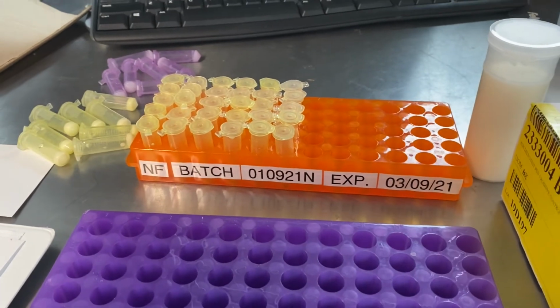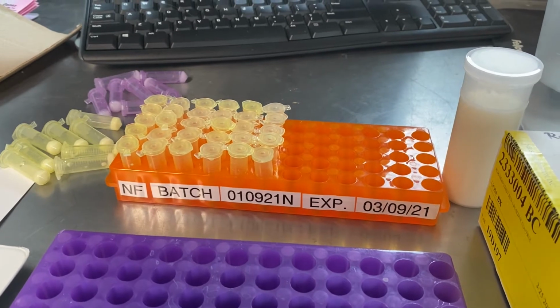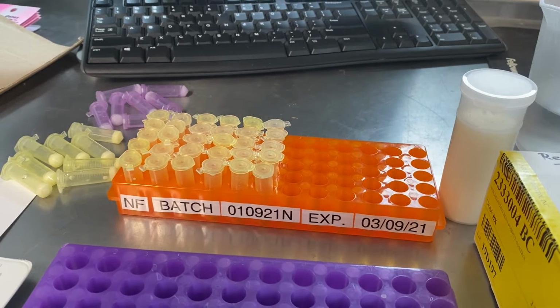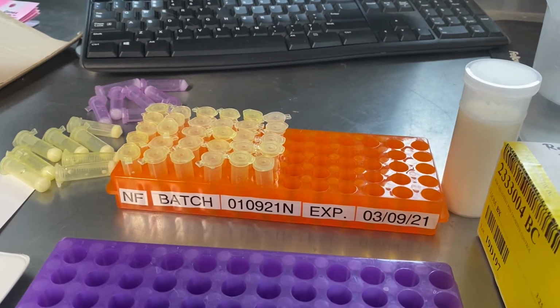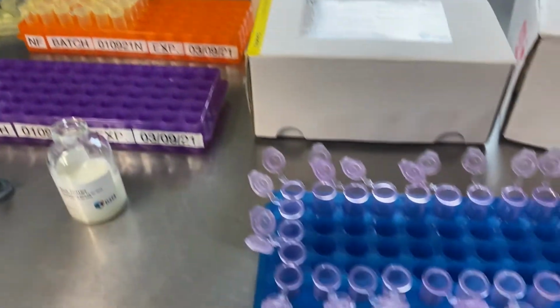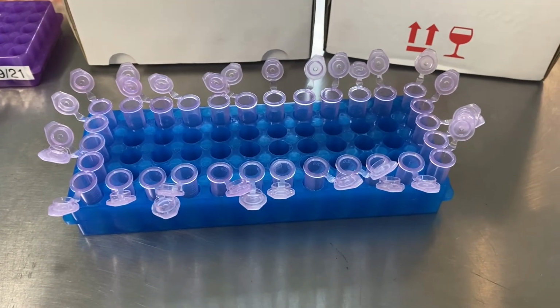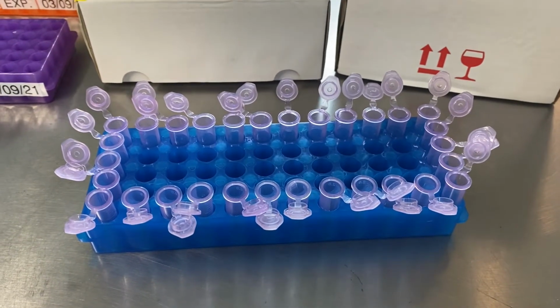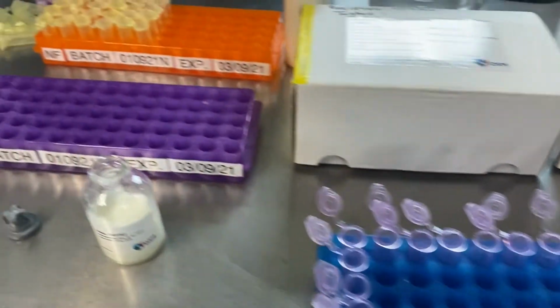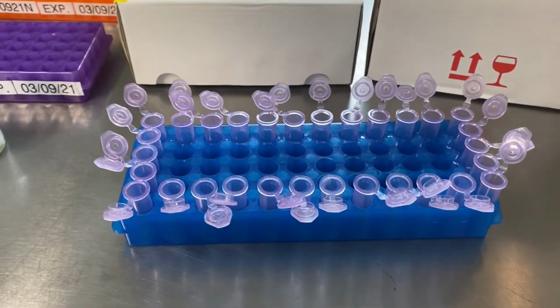All right, there are our not found controls ready to go. They don't really need to go in any particular configuration. I just cluster them all together so I get a better sense for how much I've used. There's 30 sample vials in all. 30 is also what fits around the outside perimeter of one of the tube racks, and it's just a lot easier, I've found, to go around in a circle. The lids tend to get in the way when you're filling them if you have them all clustered together like this. So when you're filling, we go around the outside of the tube rack.